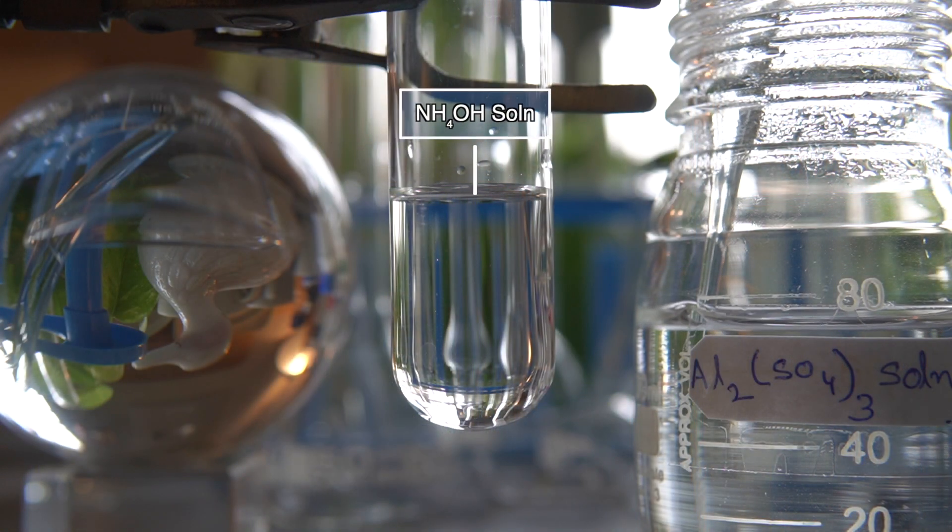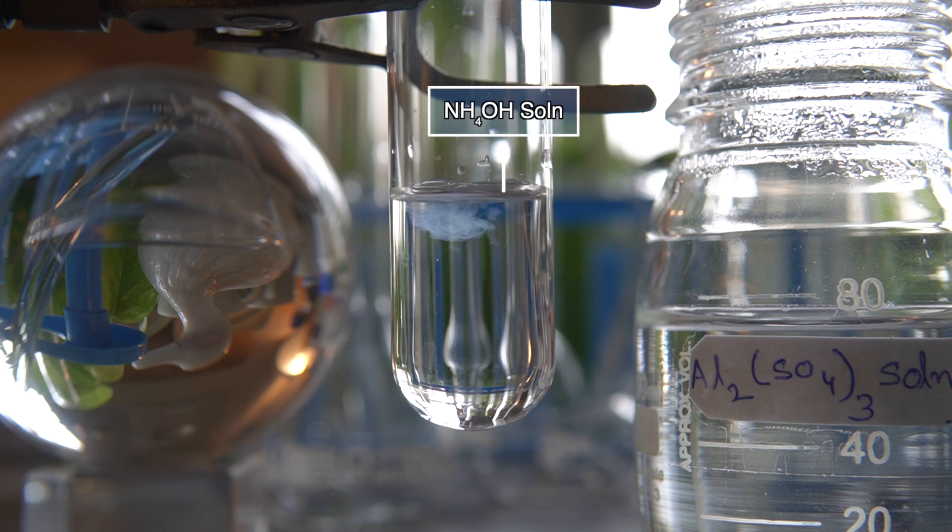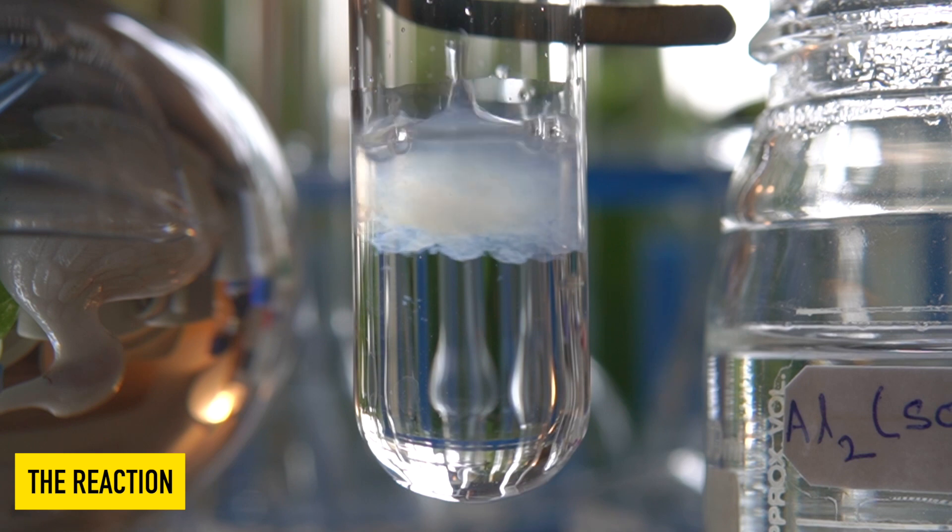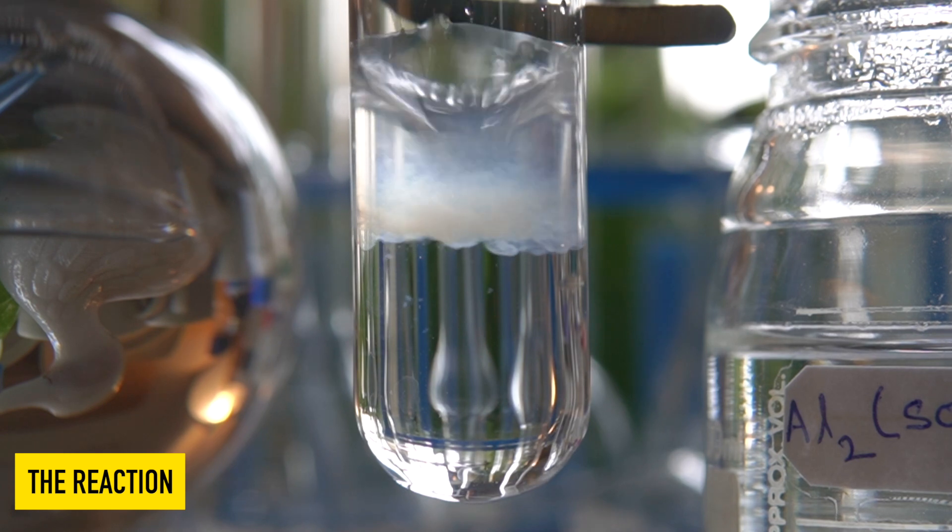Now we will add the clear solution of aluminium sulphate dropwise onto the ammonium hydroxide solution and observe the effects.